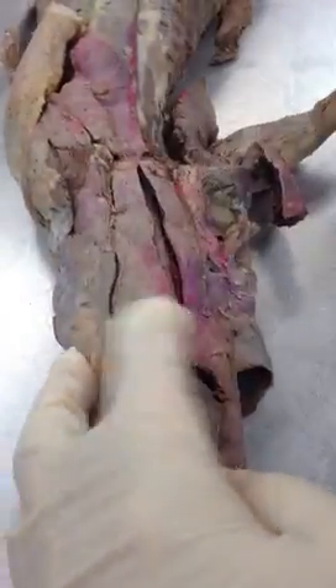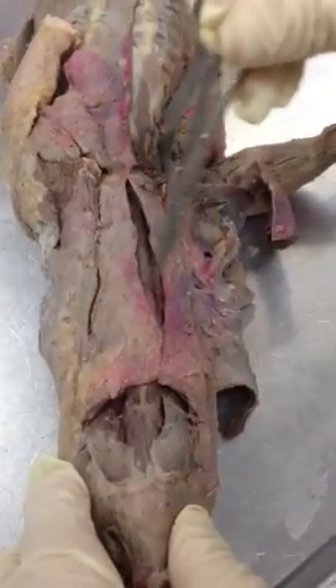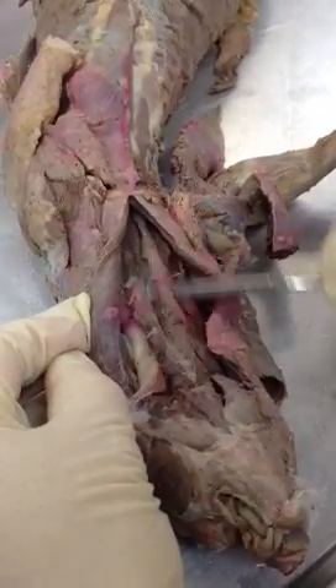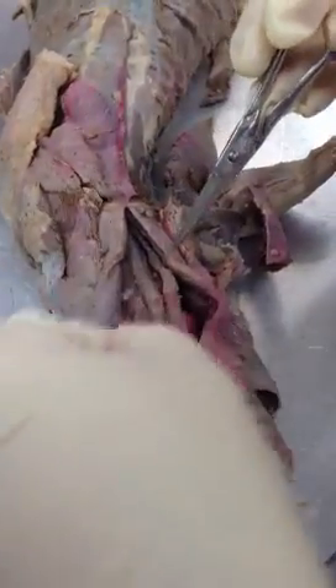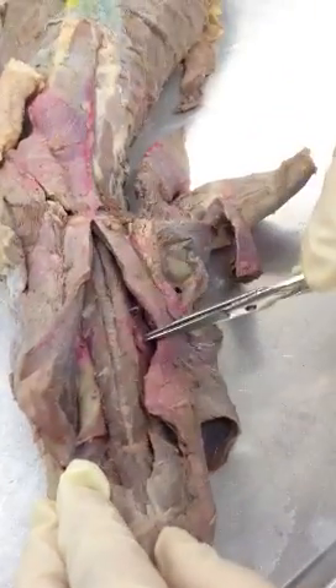Put this back together. In the neck, these two muscles are sternomastoid. Open them up like so. You have two long, thin, parallel muscles — sternohyoids. So those are sternohyoids. Now, you guys also had sternothyroid, which these scissors are too blunt to dissect out, but it's deep to this muscle. We have the thyroid gland.